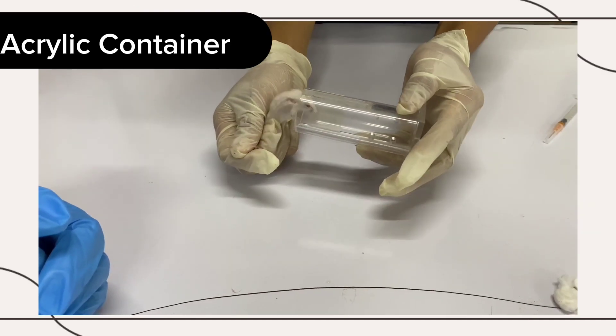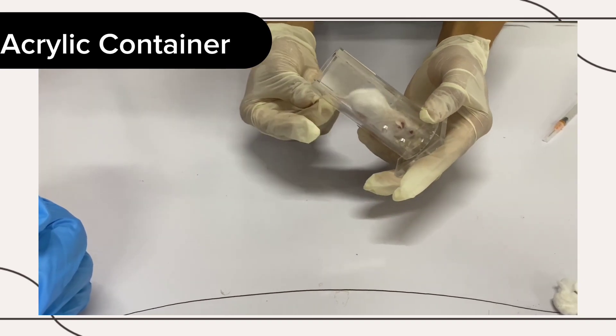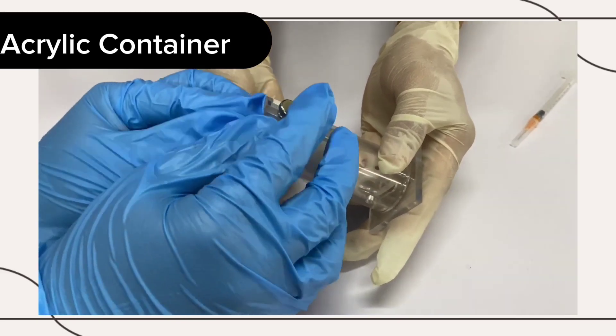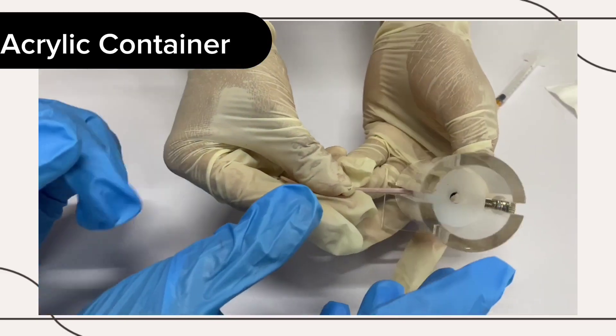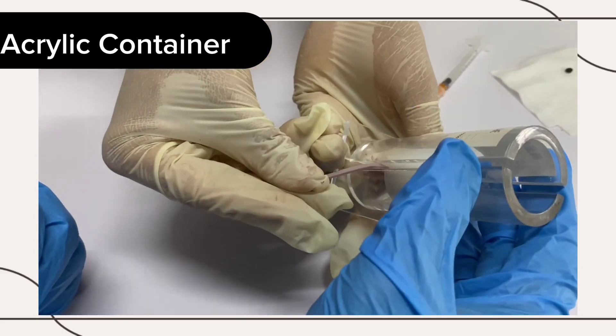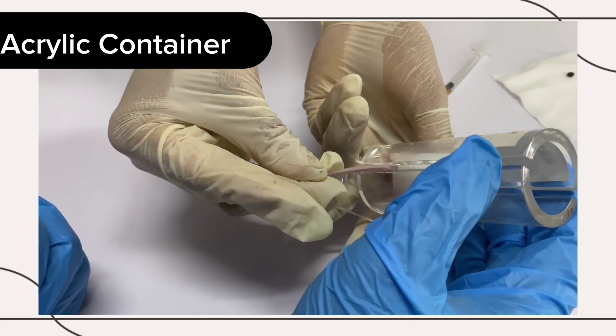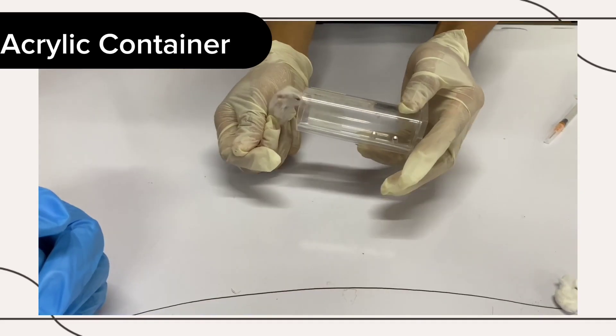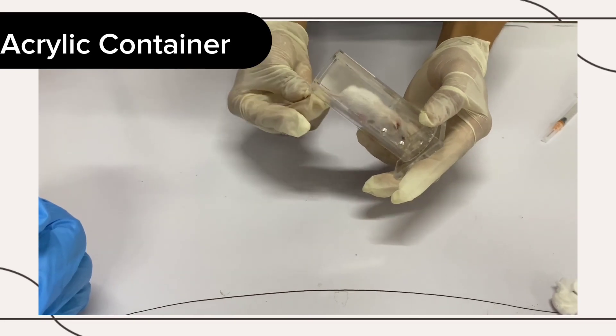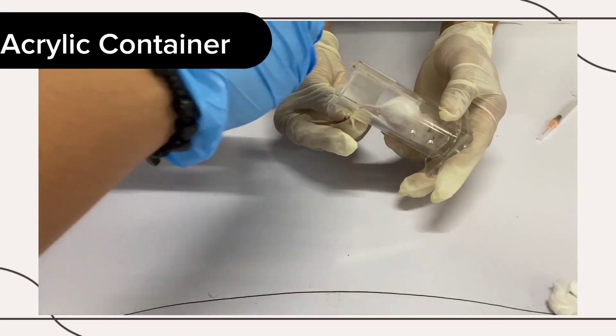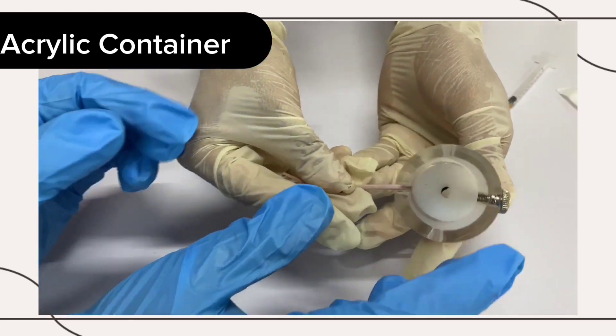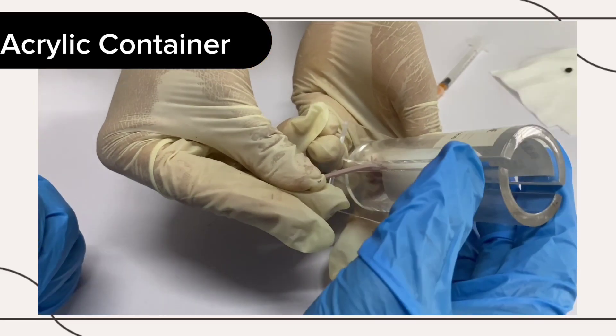Place the mouse in the container, gently guide the mouse into the container through the open lid, then close it with the use of the closure at the end of the device while gently pulling the tail longitudinally across the sleeve. This restraining method of restraining mice with acrylic or rigid plastic container for tail access is a great procedure for injections or tail vein injections that are tricky.